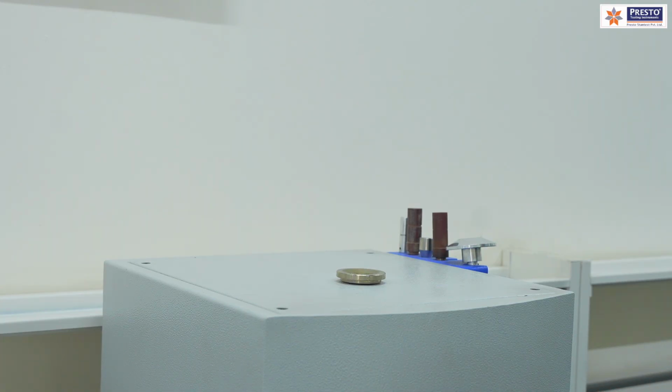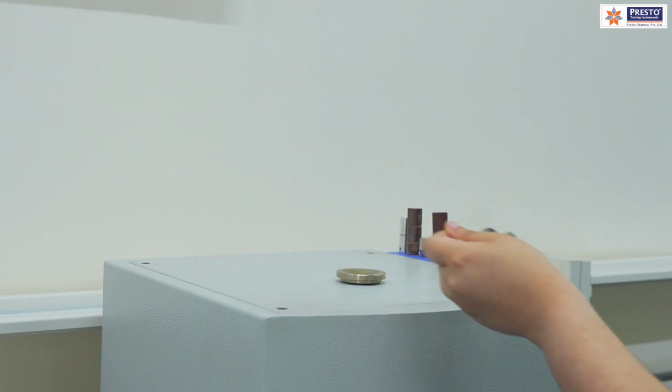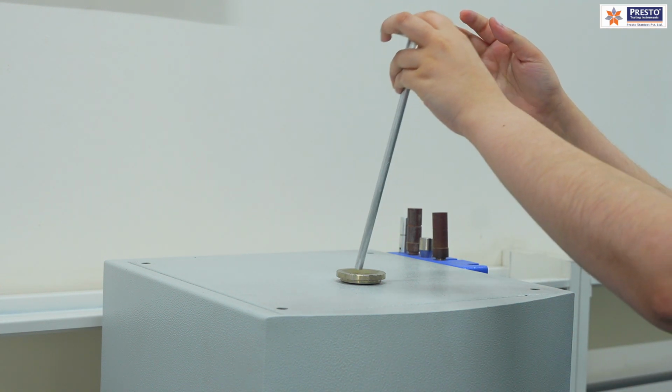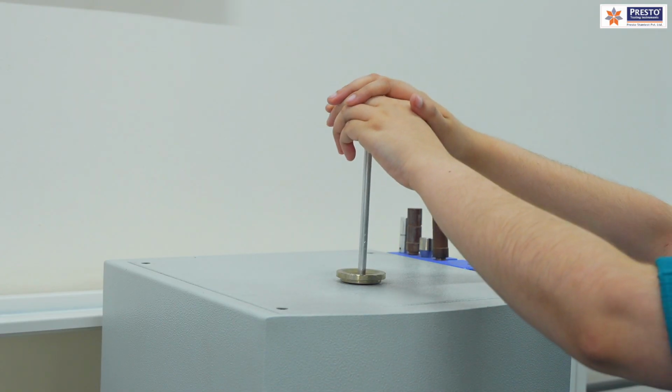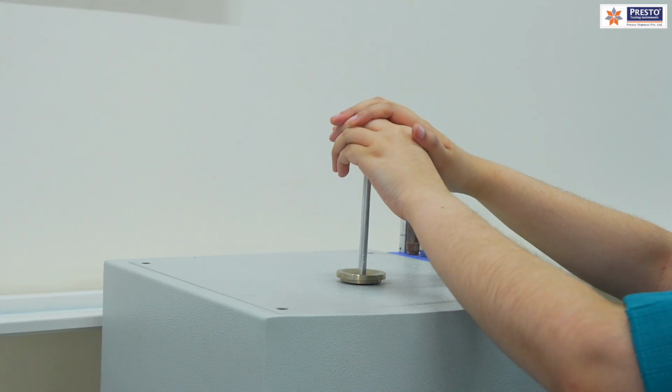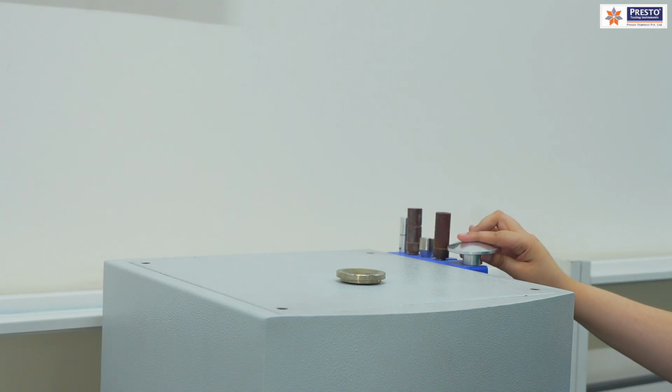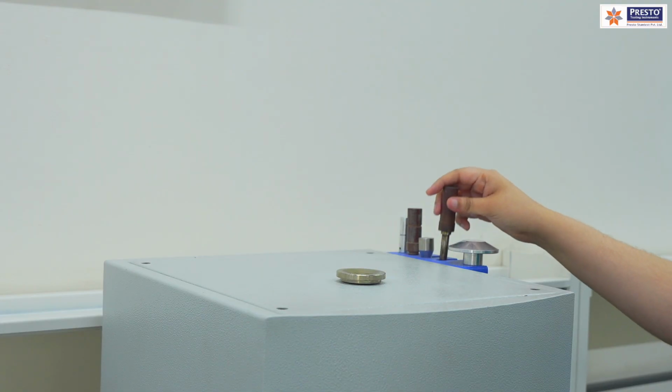The bore size is defined to have a 2 mm diameter of that orifice, and the length has to be 8 mm. So those things are defined, and then we can perform it. This is enough. Now we need to use the press tool to release the vacuum, so air bubbles will not form, and you will get a proper sample. This is how the standard defines it.